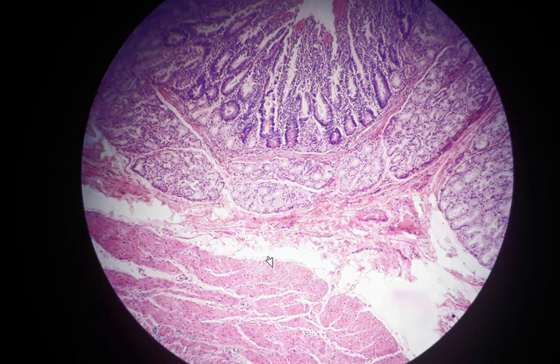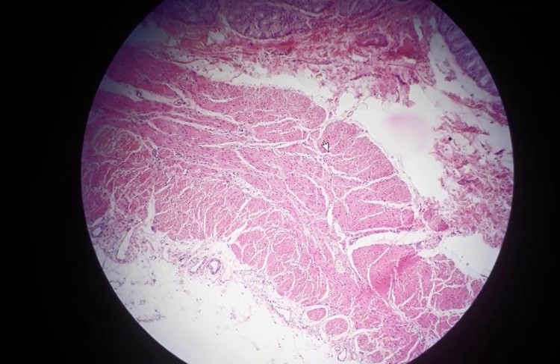I want you to focus really on submucosal spaces. As you can see, the duodenum is characterized by the presence of mucus secreting duodenal glands or glands of Brunner in its submucosa. And here, the two layers of the muscularis externa are present, and outside, this is the adventitia.